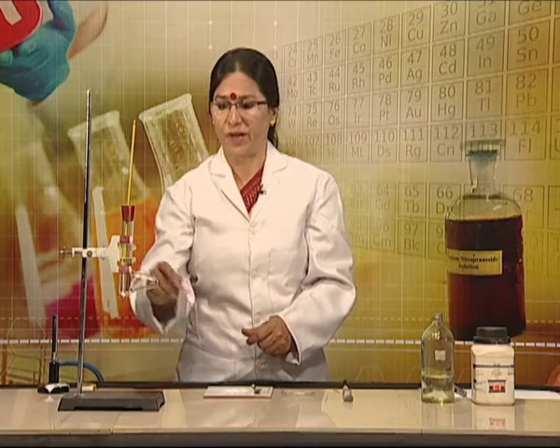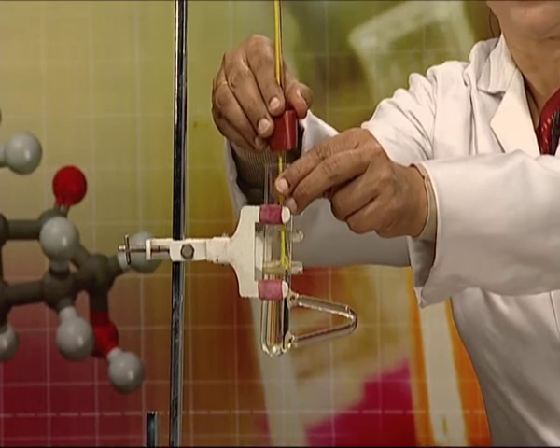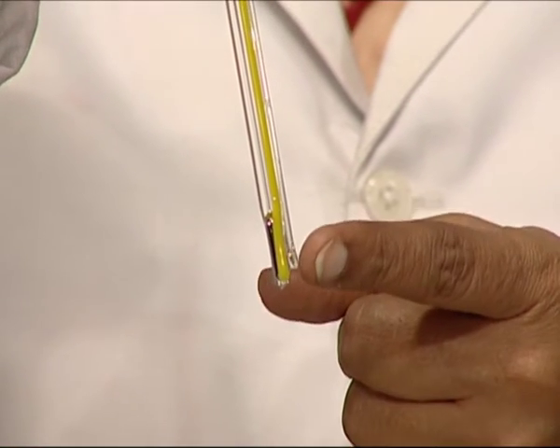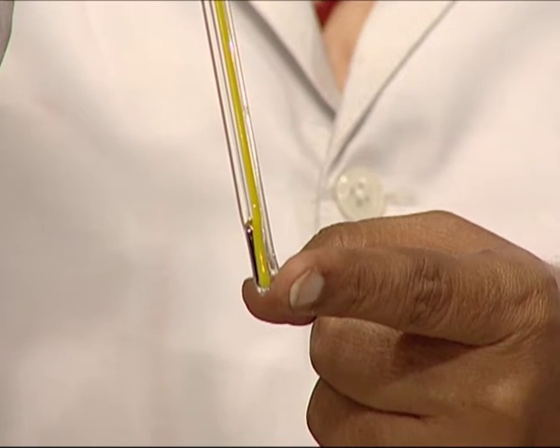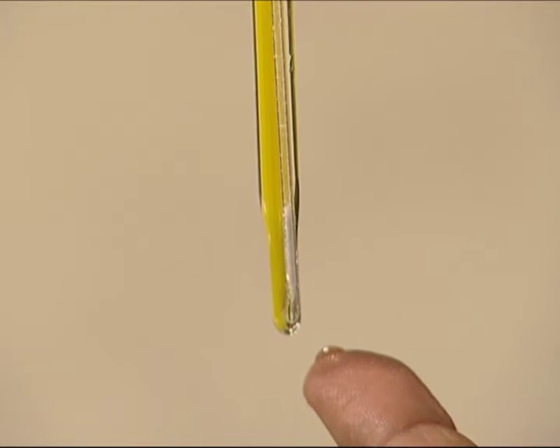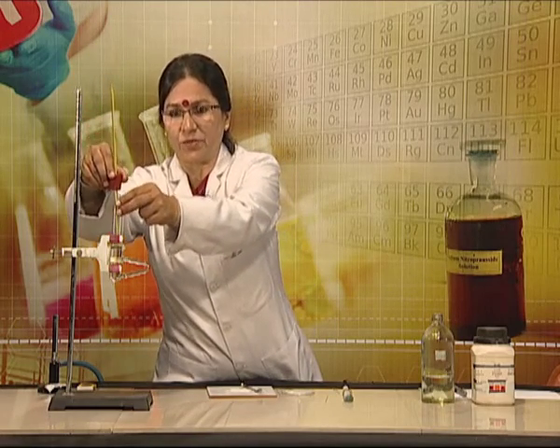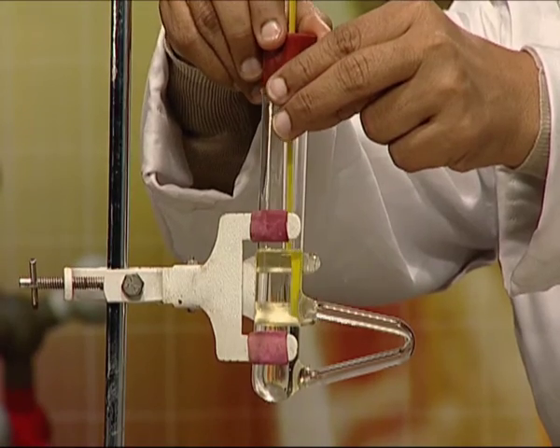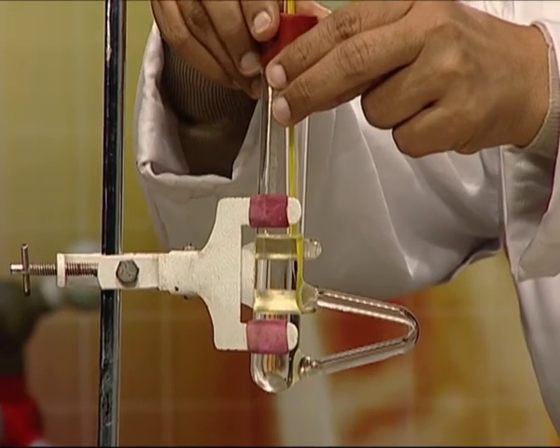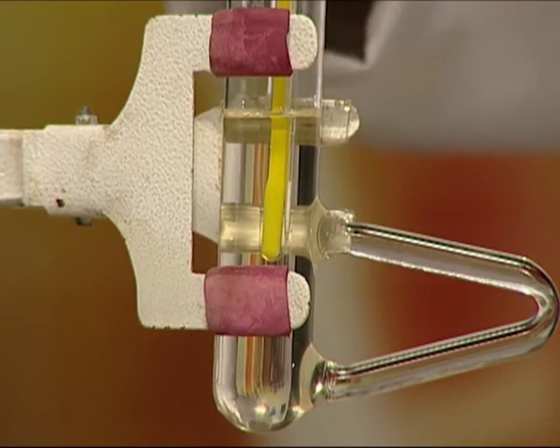Now we will moisten the capillary tube with liquid paraffin and stick it to the thermometer. We have to make sure that the bulb of the thermometer and the sealed end of the capillary tube are at the same level. Then we will dip the thermometer along with the capillary tube into the liquid paraffin so that the thermometer bulb and the filled capillary portion are completely dipped, while the open end of the capillary remains in air.